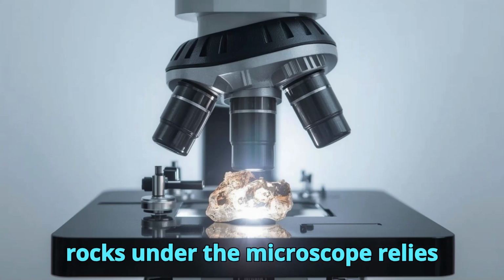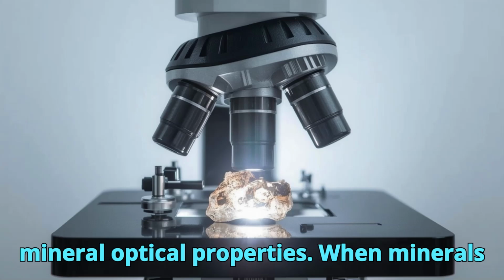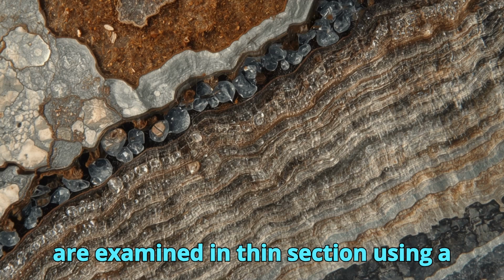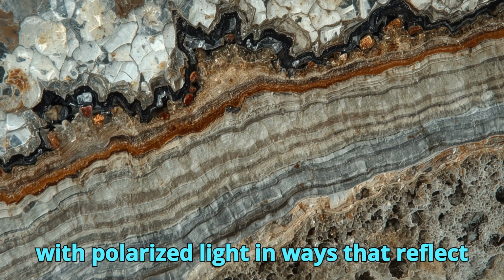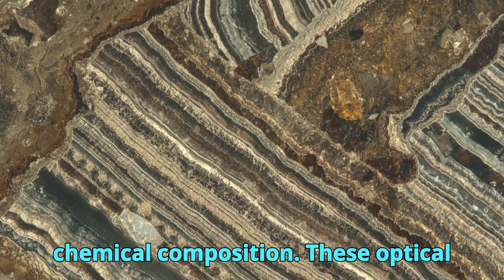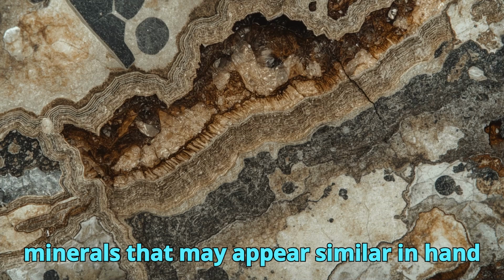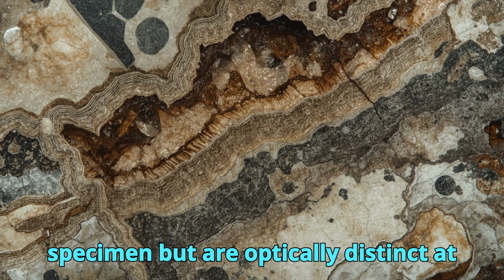Mineral optical properties used in rock identification. The identification of rocks under the microscope relies fundamentally on the recognition of mineral optical properties. When minerals are examined in thin section using a petrographic microscope, they interact with polarized light in ways that reflect their internal crystal structure and chemical composition. These optical behaviors provide a systematic and reliable framework for distinguishing minerals that may appear similar in hand specimen but are optically distinct at the microscopic scale.